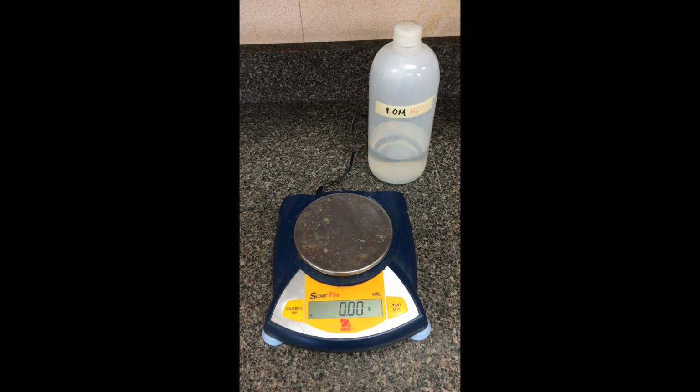In part 3 here, we're going to investigate the impact of having different temperatures. So I'm going to take my acid solution here, dropping it at 4 different temperatures, an ice water bath, a room temperature, one that's slightly warmer and one that's close to boiling, and see the impacts of reaction rate.